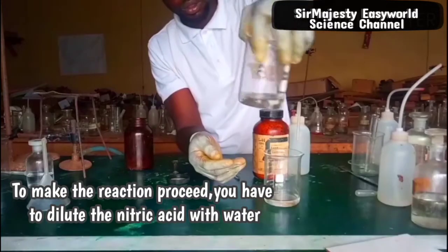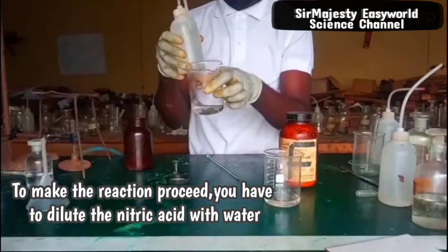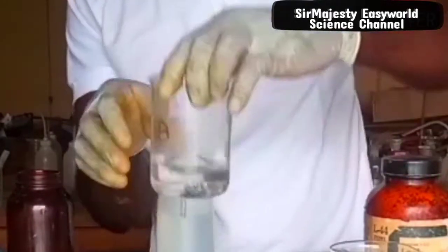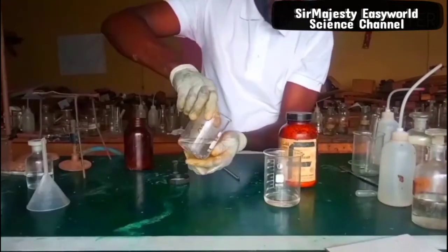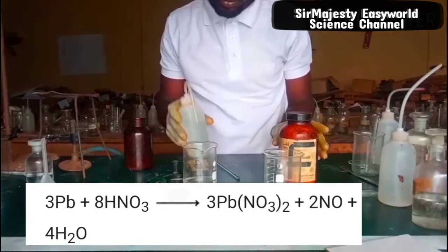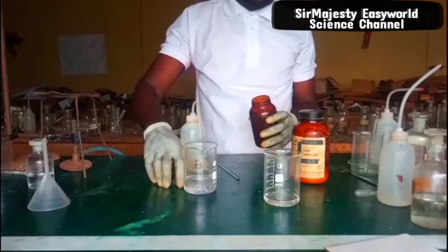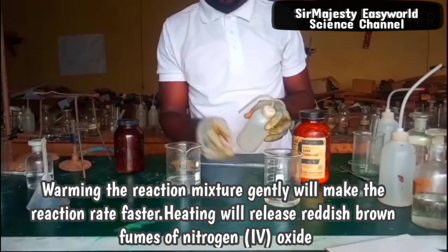We need to dilute the nitric acid so that the reaction will proceed. Actually, the reaction is a bit exothermic when you dilute it. You can now see there is a kind of stain covering the lead metal. This reaction is not actually a displacement reaction because nitric acid is a strong oxidizing agent, such that the hydrogen that could have been released will be oxidized to water. The next method is to react lead carbonate with dilute nitric acid.